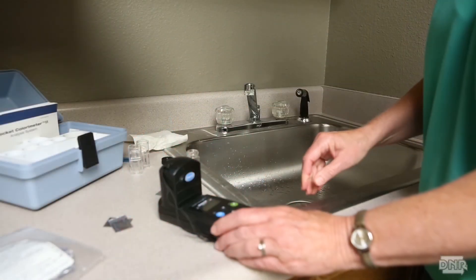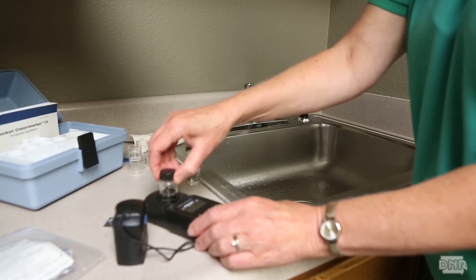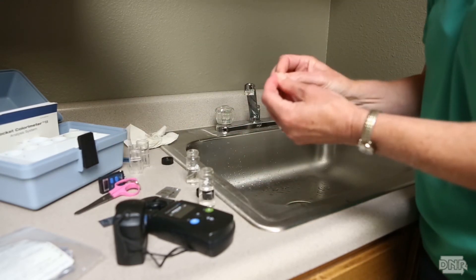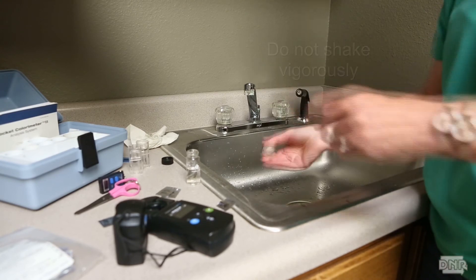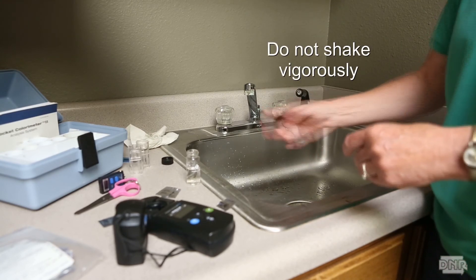Zero the instrument. Remove the vial and add one reagent packet. Shake the vial to mix. Wipe the vial and read the value immediately. The free chlorine must be measured immediately — record the value. To confirm that you are using free chlorine as the disinfectant, measure the level on this same sample at 30, 60, 90, and 120 seconds.